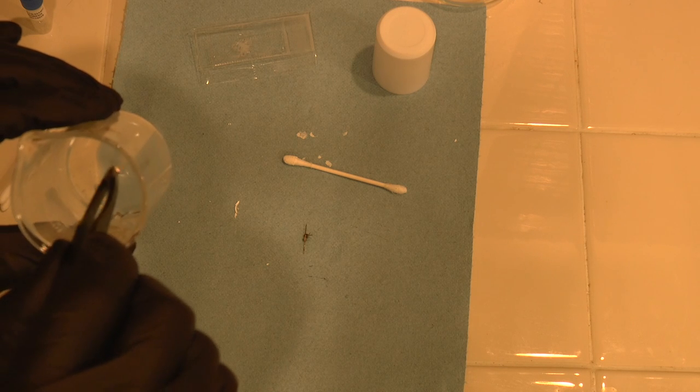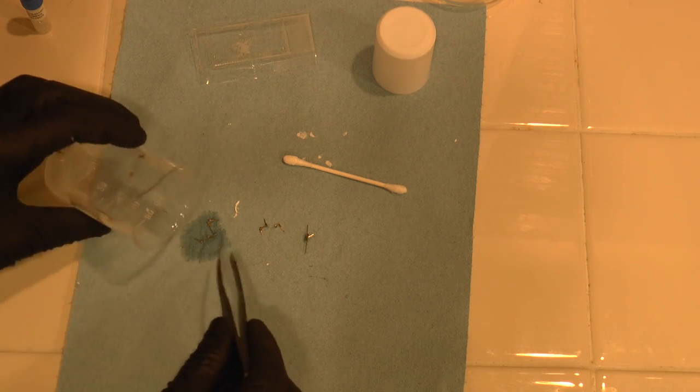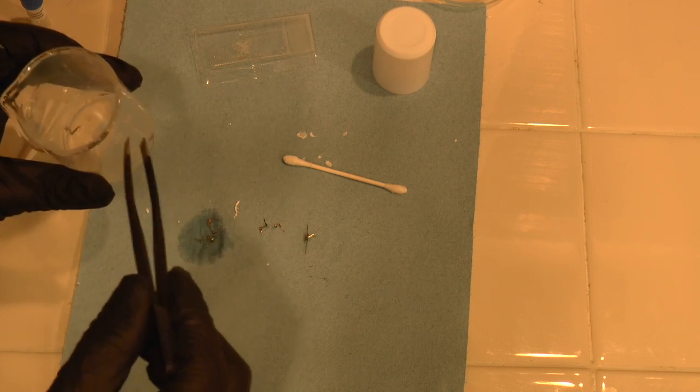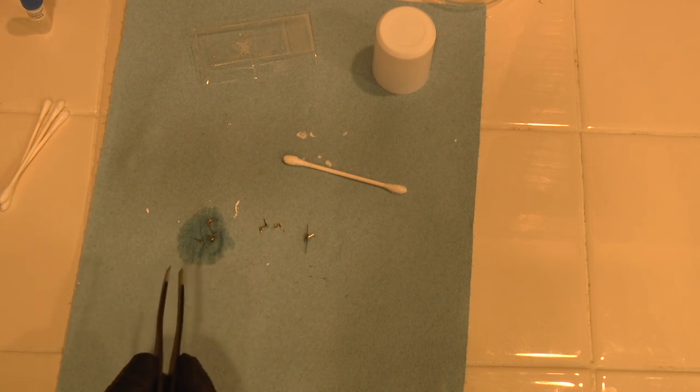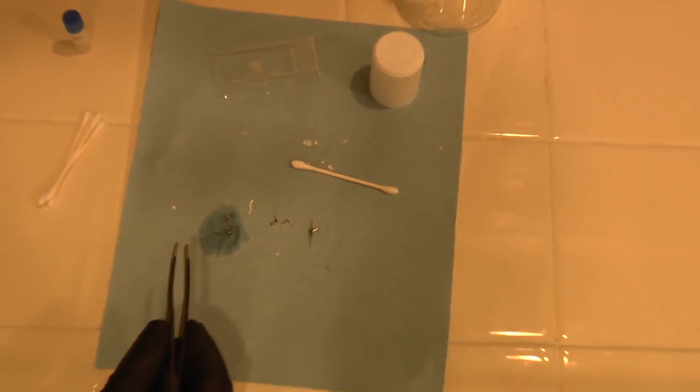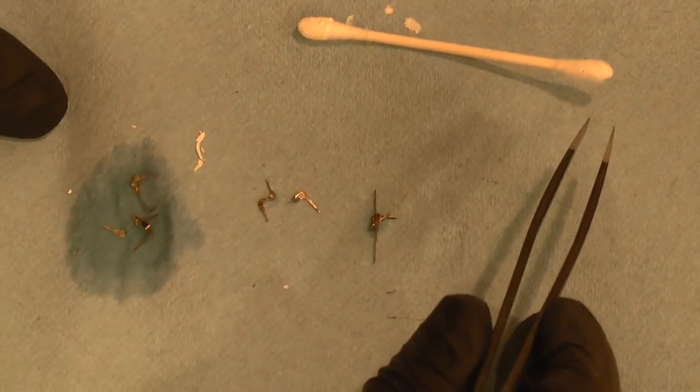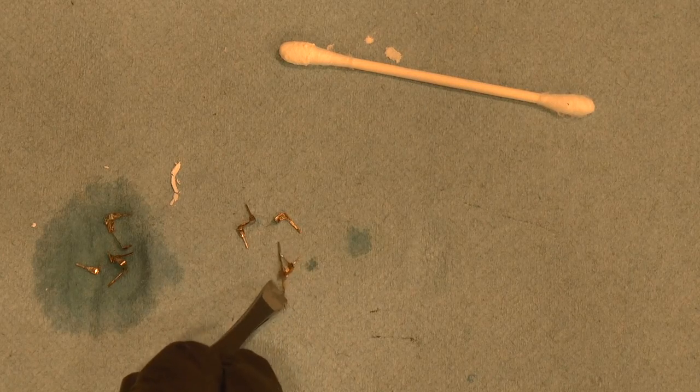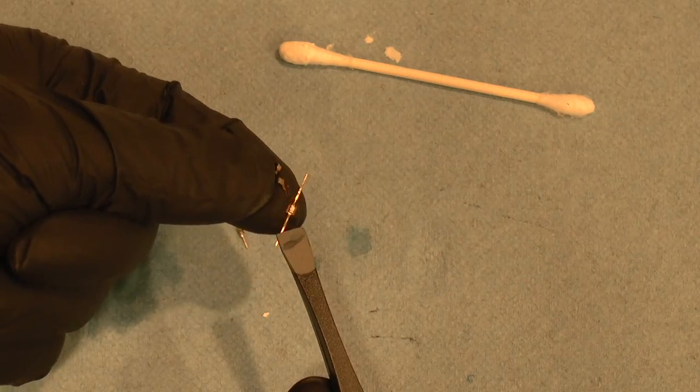I didn't know it at the time, but yes, it is actually there. I'm just sort of picking through the rest of the debris, wondering where the die is. But then I soon realized that the die is actually attached to that central portion of the lead frame. Zooming in. Yes, on the die. Now there are very thin wires attaching a couple of pins to it, so I'm just going to pull those. No big deal. The wires will break very easily.